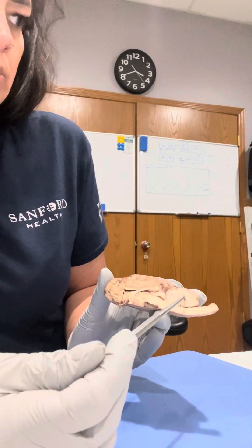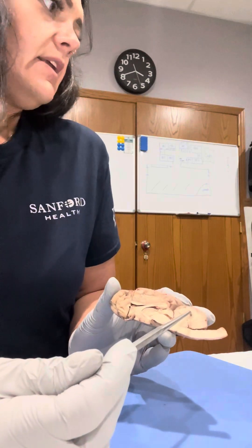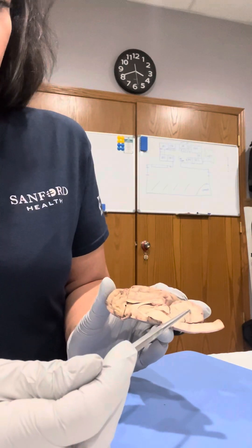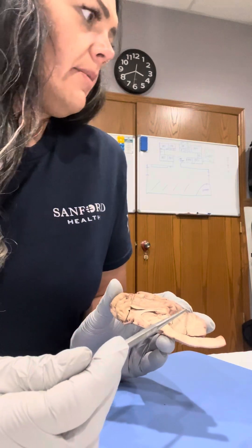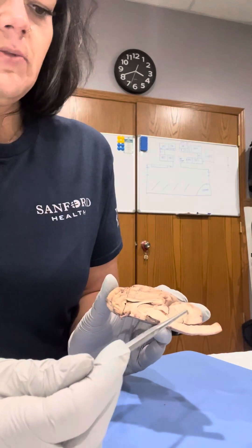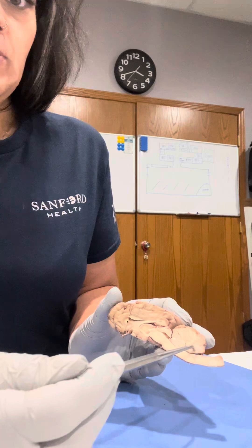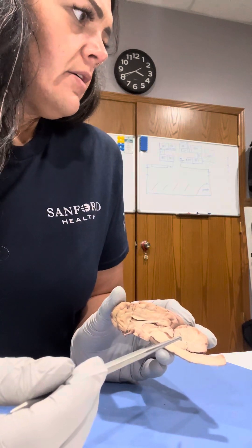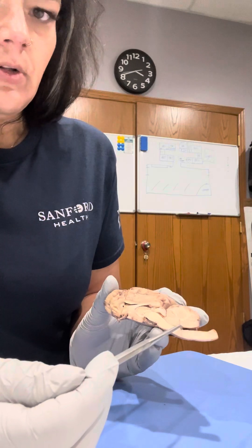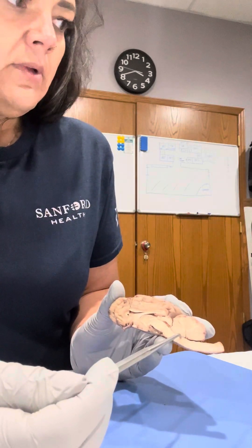Then we're going to go back to the cerebellum. The cerebellum is here. You can see that tree-like structure which is your arbor vitae, right here, which is pretty cool because you can see it really well. From there you can see the fourth ventricle which is going to be right in here.